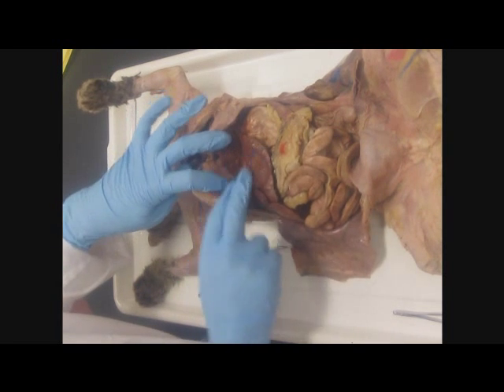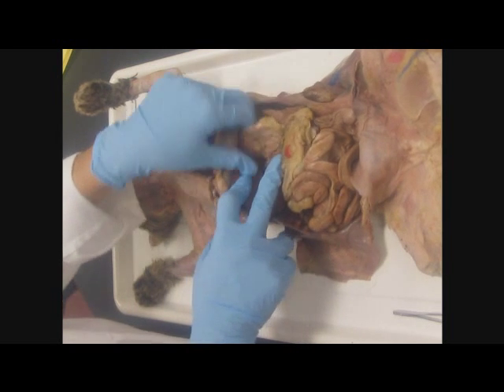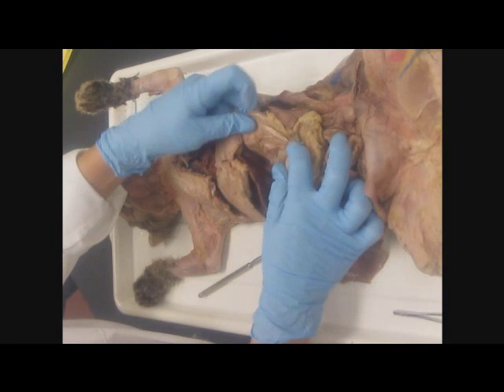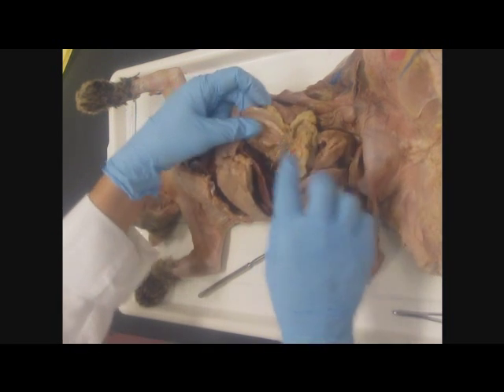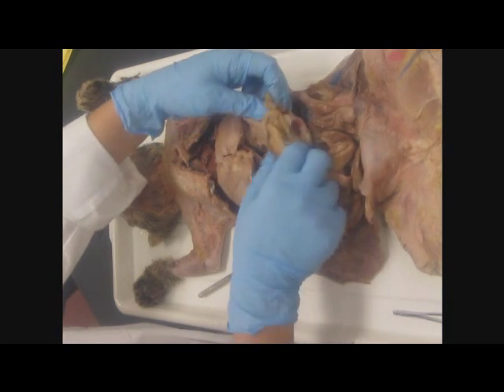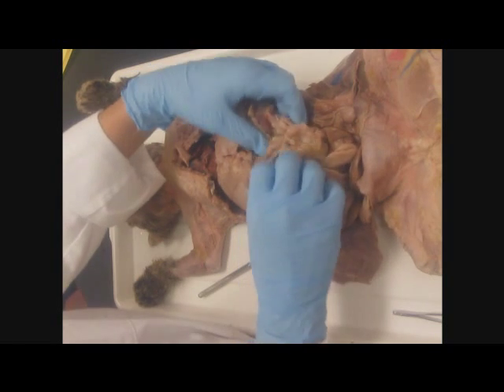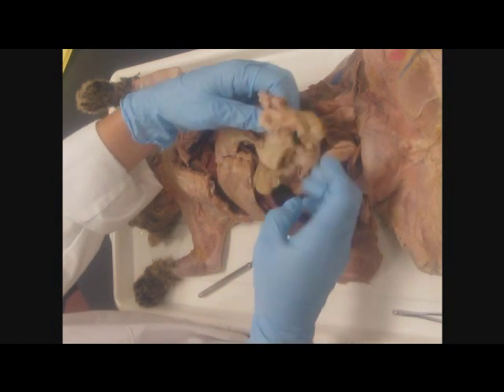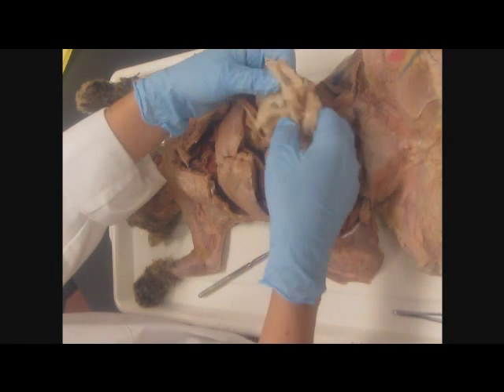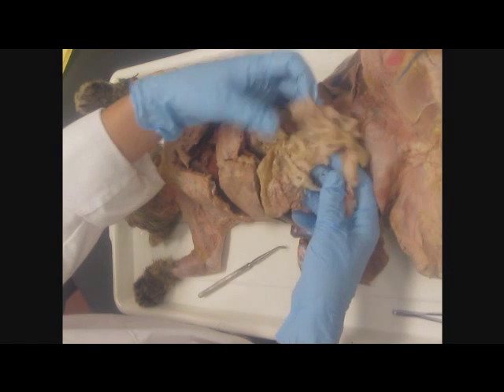Now this big brown thing is the liver, so you gently lift that back. And this giant pouch right here is the stomach. Okay. There it is. Now, along the greater curvature is this thing that looks like fat. But it's actually a membrane that can fill with fat. And if you gently unravel it, you might have to unravel it from around some intestines and things. I did that when I washed out the cat. Okay. This great big membrane is the greater omentum.